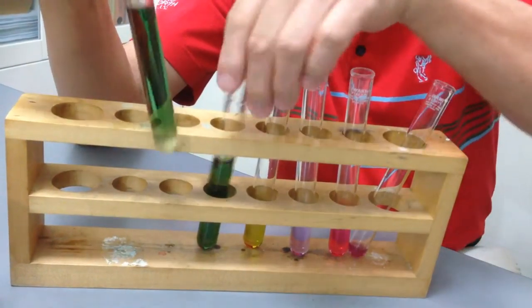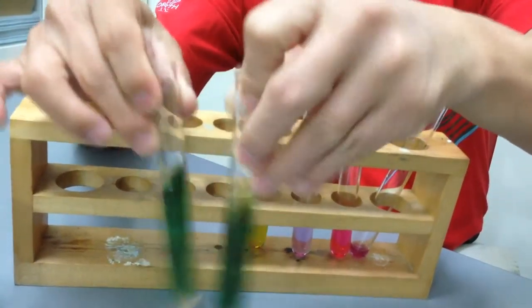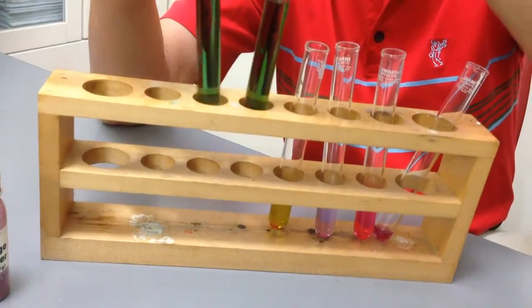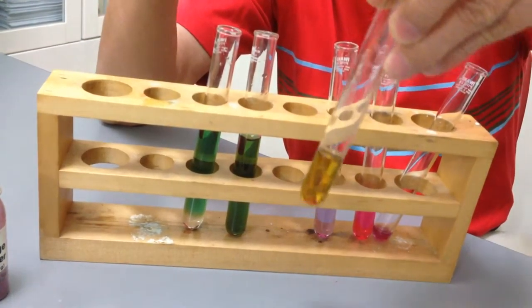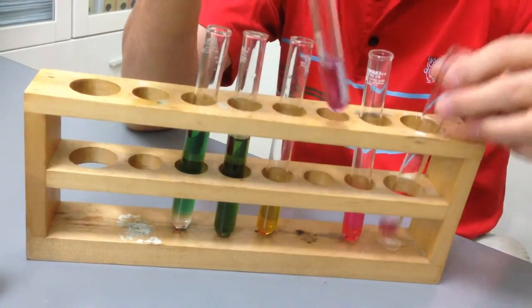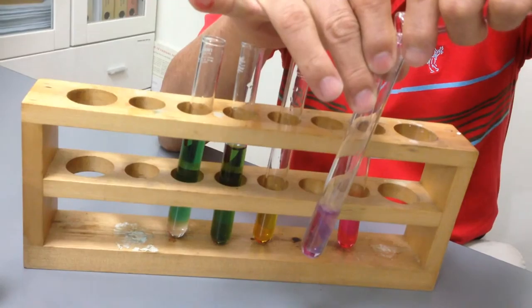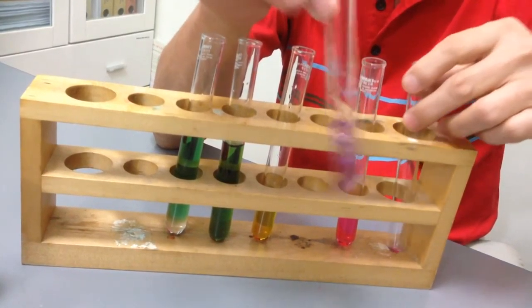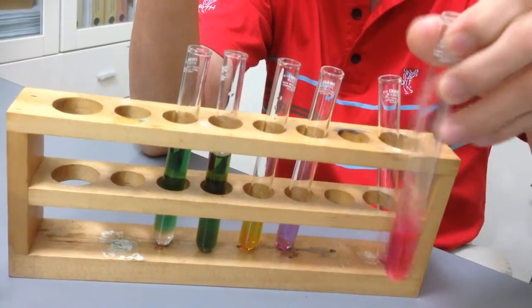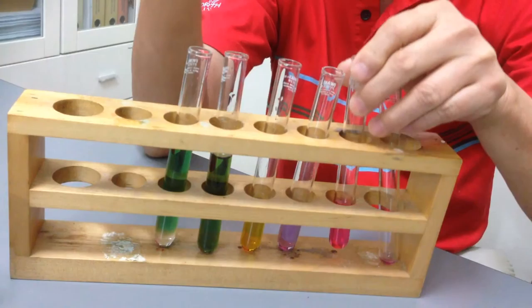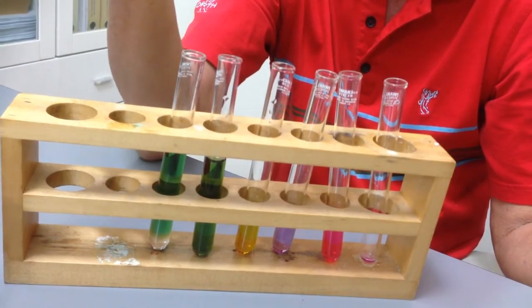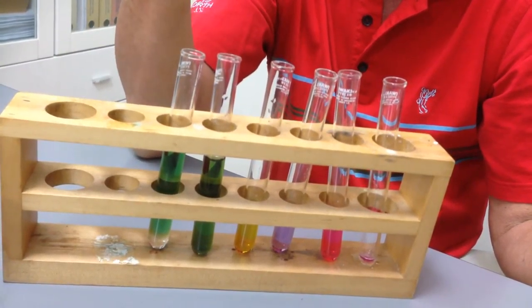Well, these two green solutions have slightly different green colorations. This is sodium carbonate and this is aqueous ammonia. This is sodium hydroxide which actually turns green first before it turns yellow. And this is water. Water will not change color. Water will remain as this pinkish purple. And this one is an acid. An acid will turn red. So this red cabbage can be an indicator of pH and acidity and alkalinity.